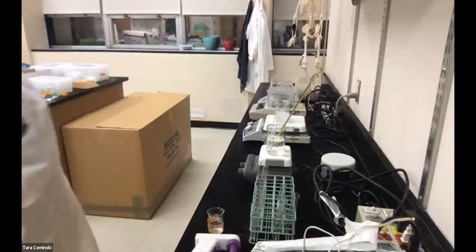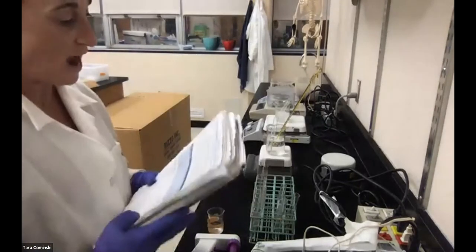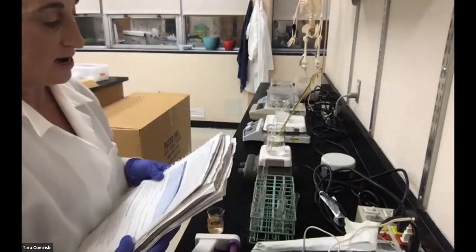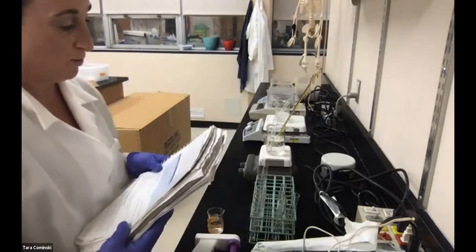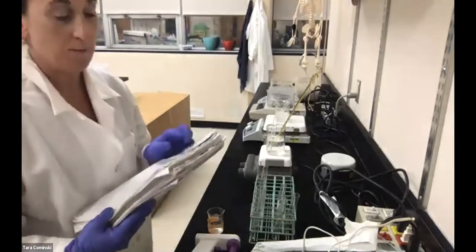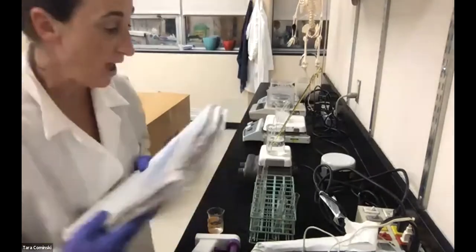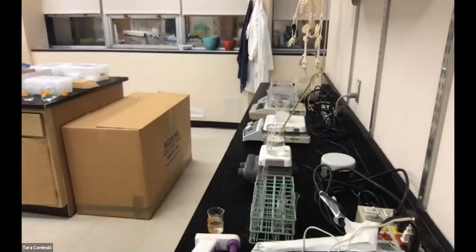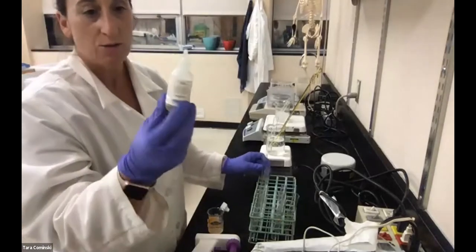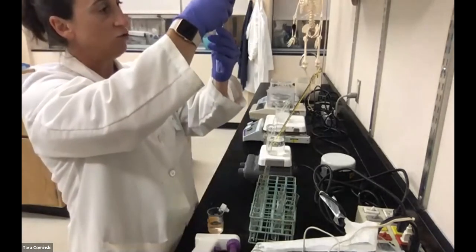Let's start off, as I said, on page 59, okay? So on page 59, it tells me to add 1 milliliter of catalase into tube 1, right? And then add 4 milliliters of hydrogen peroxide. And then we're gonna measure that bubble height, okay? So for the catalase, by the way, I'm measuring it by drops, because I have it in these dropper bottles. So it's about 10 drops, 1 milliliter.